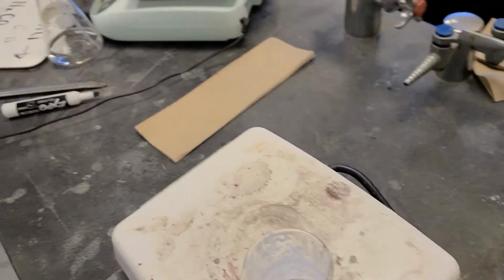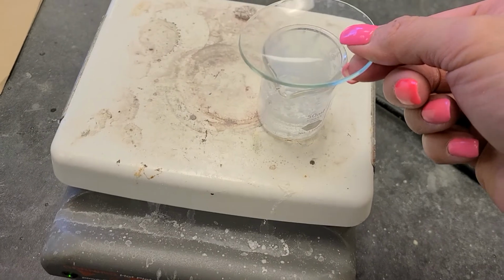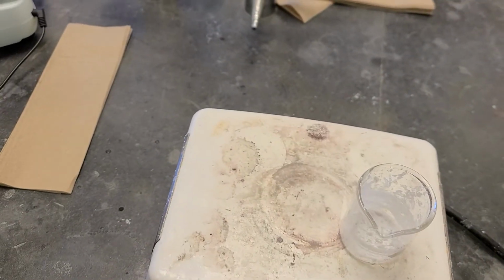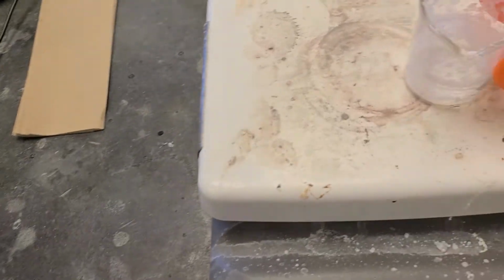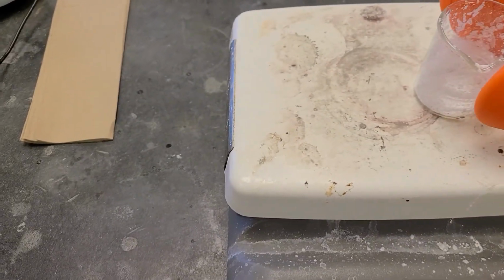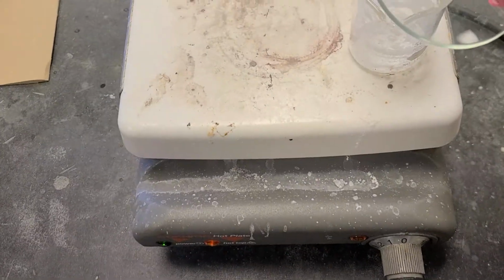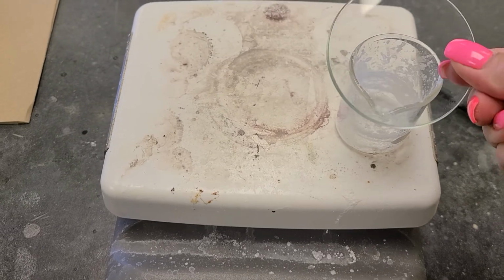One of the things that we do is what's called the vapor test. So we take a watch glass and see if the watch glass steams up. So see how it's still getting a little bit steamy? That means there's still water vapor left in the beaker. So I turned the hot plate off, just letting the water vapor escape a little bit more through evaporation to make sure that we get the best percent accuracy as possible, or percent yield. Try the vapor test one more time. Doesn't look like I'm getting any water vapor on the watch glass, so I think we're good.